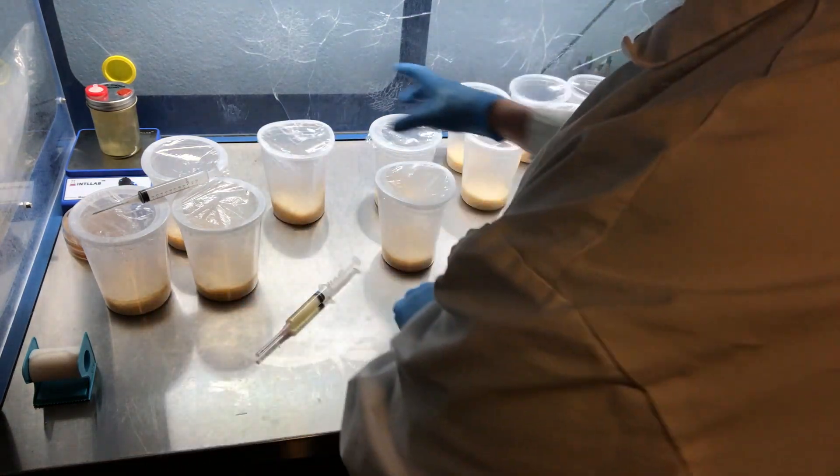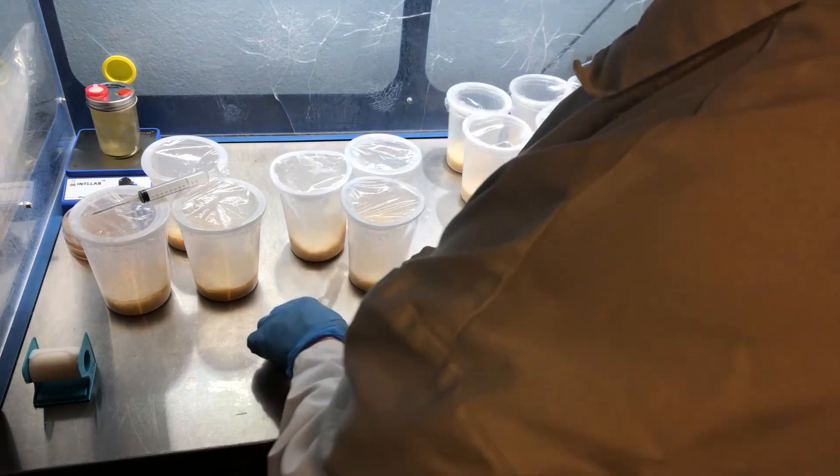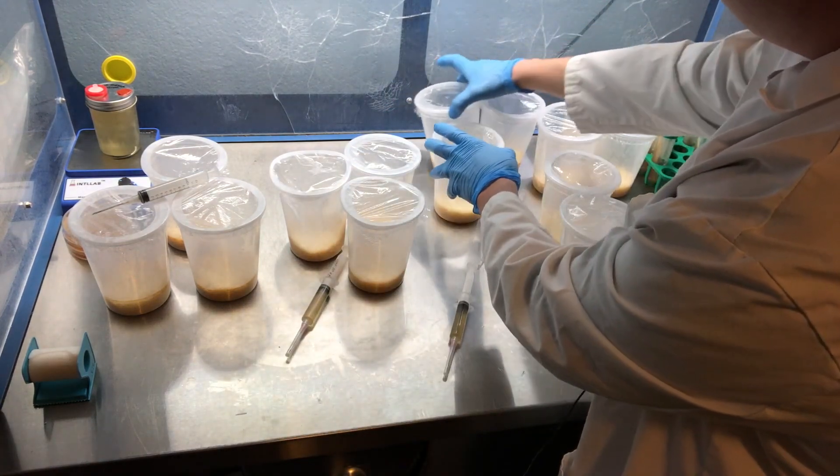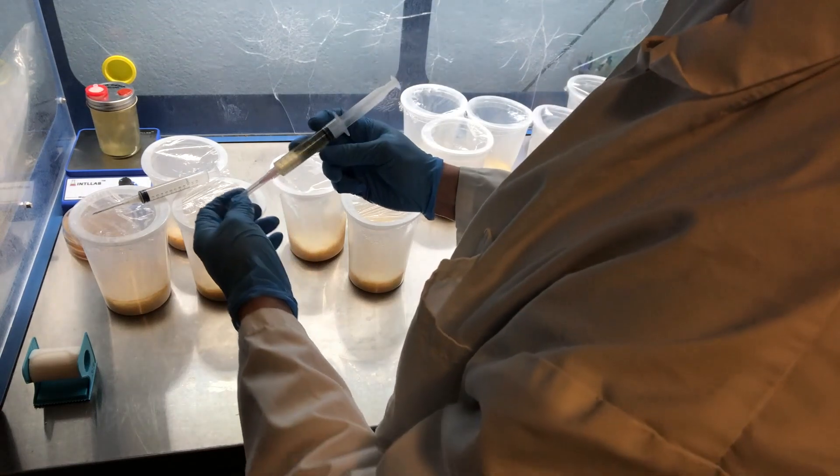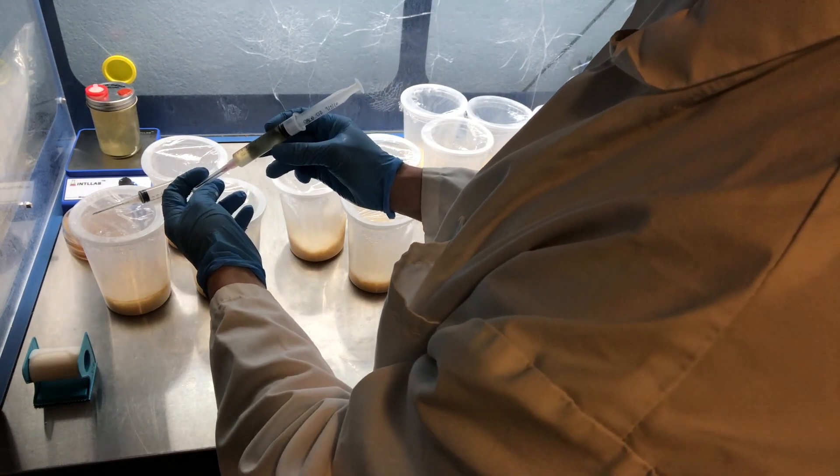Once again, inoculate. I like to do a little circle and then a zigzag in the middle. Maybe I can stretch this out for three. Alright, so for that one I used four milliliters. I guess I should try to stretch all of them out for three, and that way I won't have to dip into my jar.